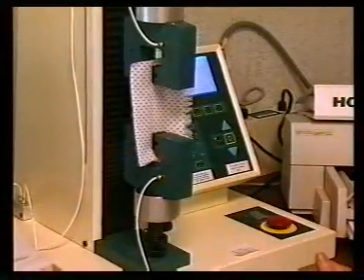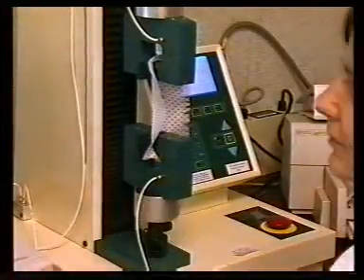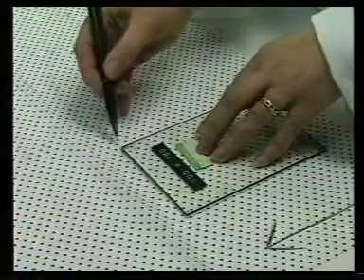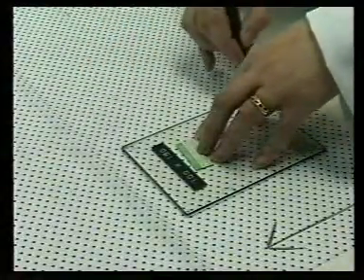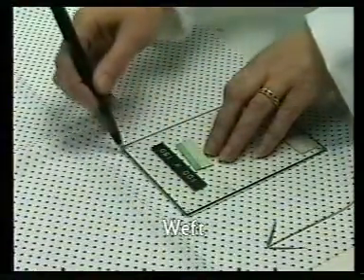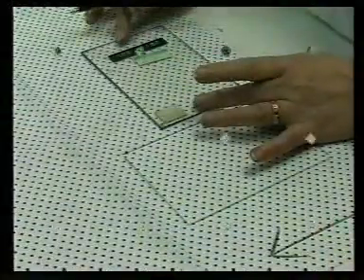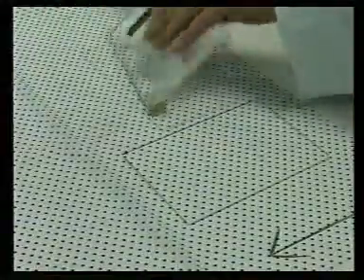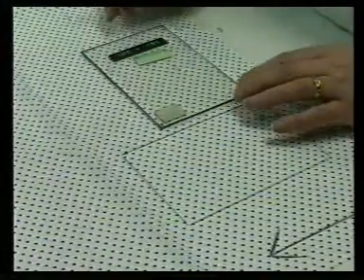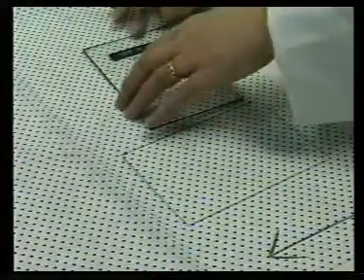The procedure shown here is the grab strength method using the Hounsfield Tensile Testing Machine. Test specimens are prepared by cutting out five specimens in the length or warp direction and five in the width or weft direction from the sample provided. The specimens are each 150mm by 100mm, the longer dimension being parallel to the direction being tested.